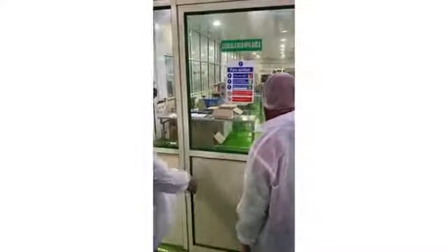Now there is a lunch time. So now today orange variant we are running. It will be the same process as you follow in beverages; here also all the raw materials get analyzed, get approved, get documented, and it will be displayed.